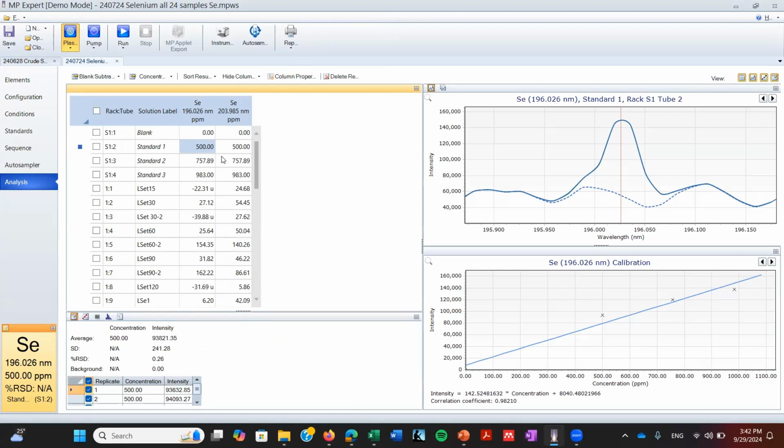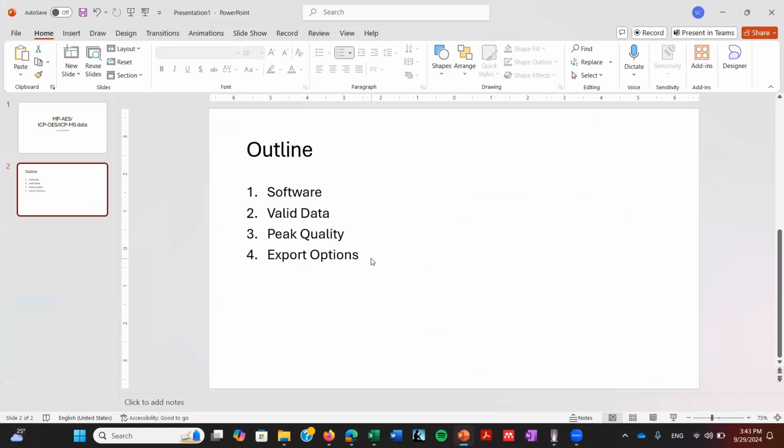So this software is very similar. I have worked with MP and also with ICP, and the software is extremely similar for both. There are going to be different functions for the ICP, probably more functions for the ICP because it's a more complete equipment if you want, or more advanced equipment. But essentially, it looks extremely similar. So we covered the software a little bit.